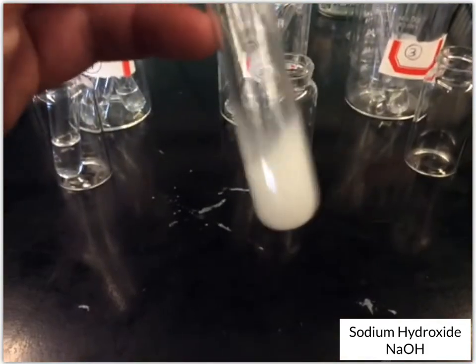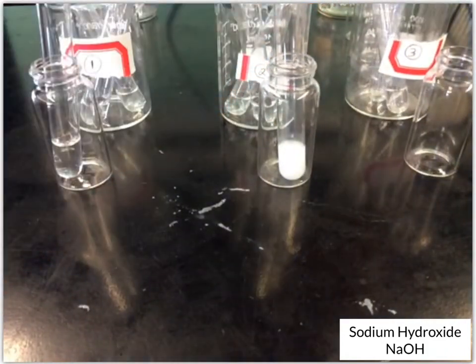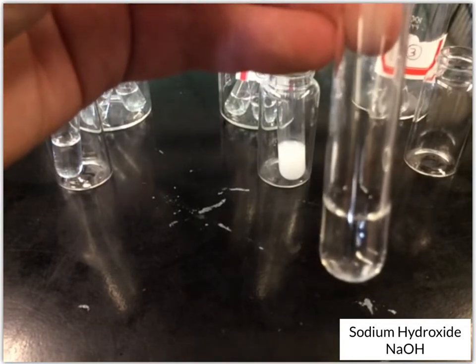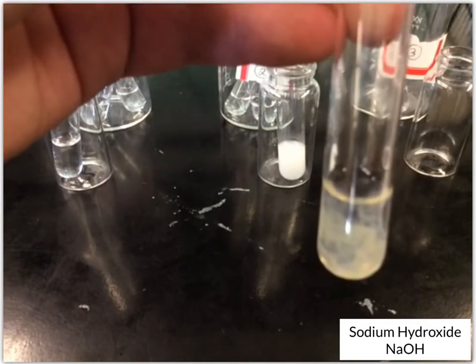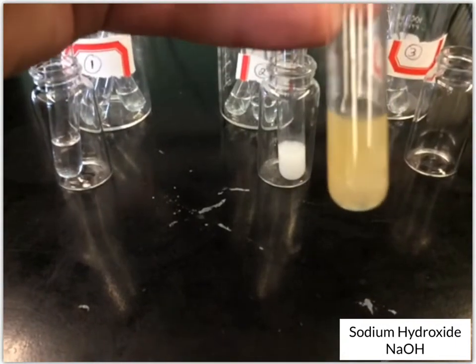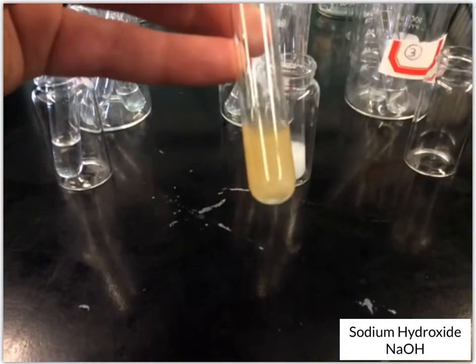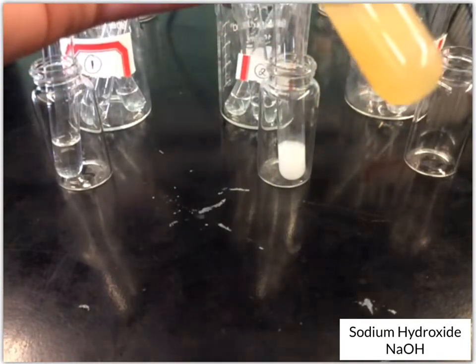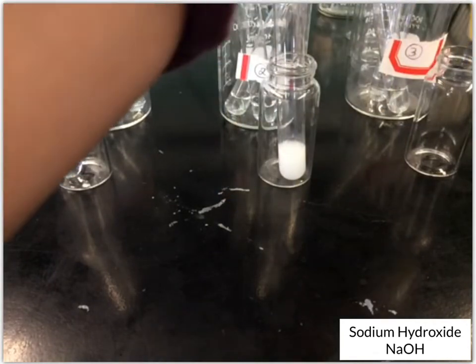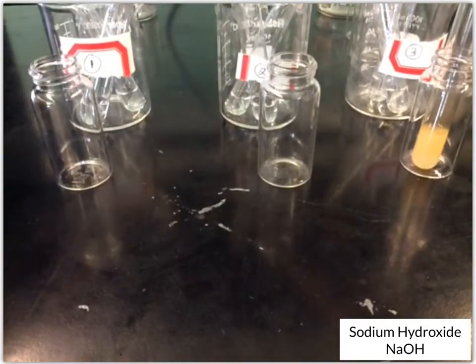And that one definitely has some white precipitate that formed. And then last, we've got unknown number 3. And that one also got kind of cloudy, but this one's actually a little bit yellowish. We definitely have some precipitate forming, but it's a different color. Okay, so that's our test results with sodium hydroxide.